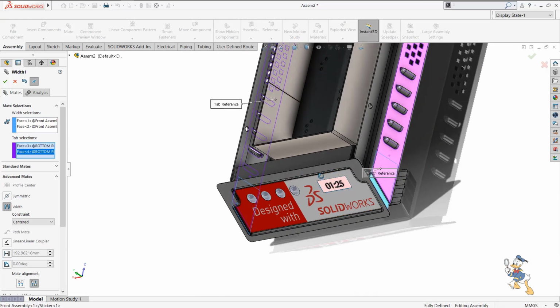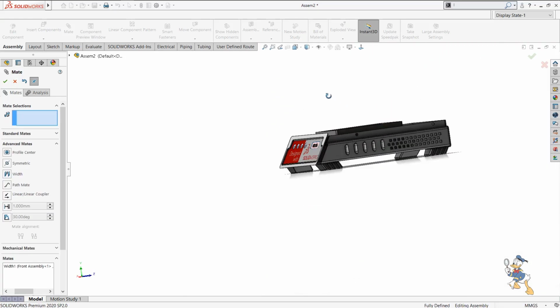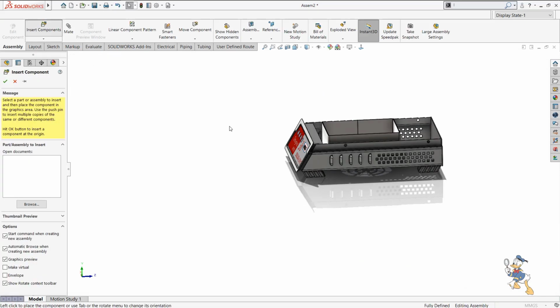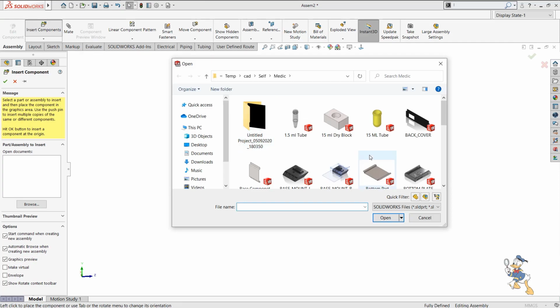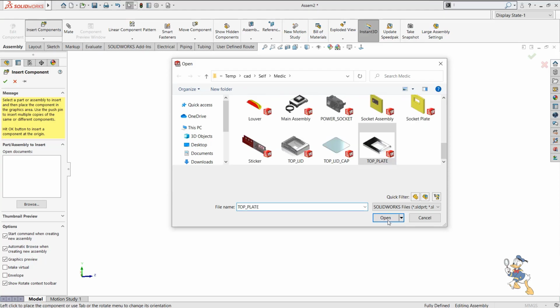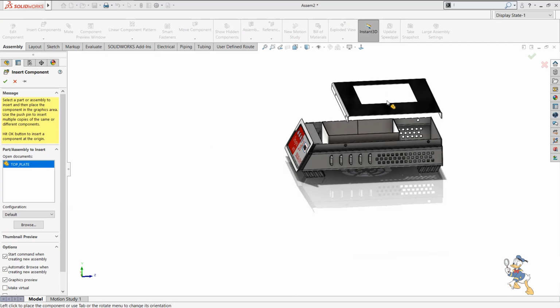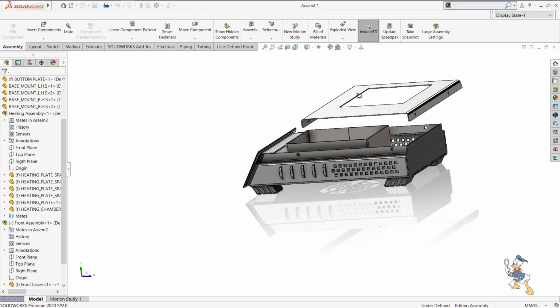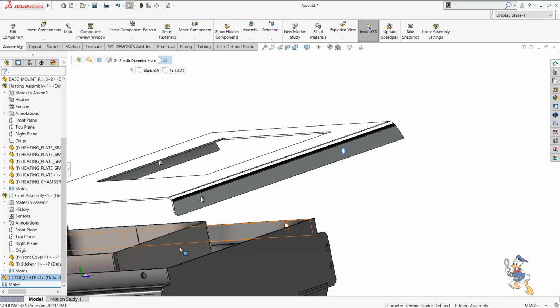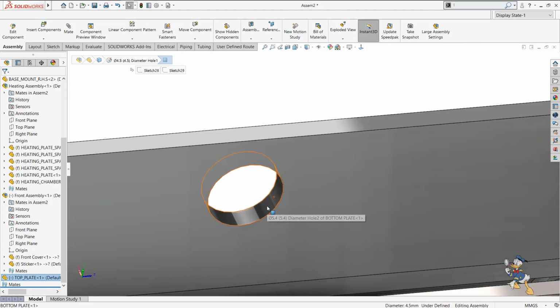And yeah, this is concentric. Oh, sorry, width mate with each other. Suppose I just need to cover up this assembly with lid 1, so I just need to select lid 1 over here. There must be a lid, yeah, the top plate over there. I can place it over here. I just need to put that plate, and by making mates with the components, it is very easy to place that component in the assembly.